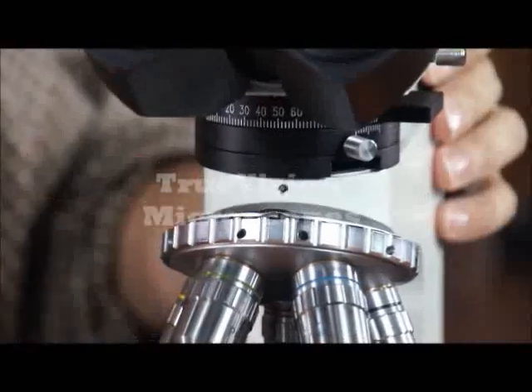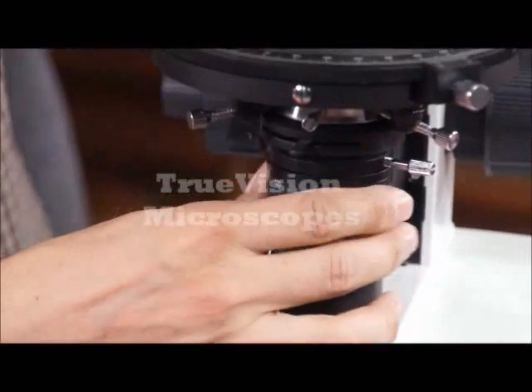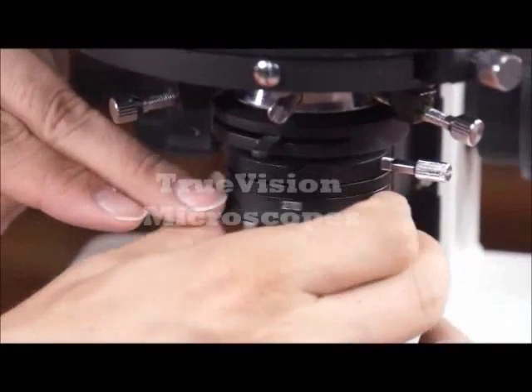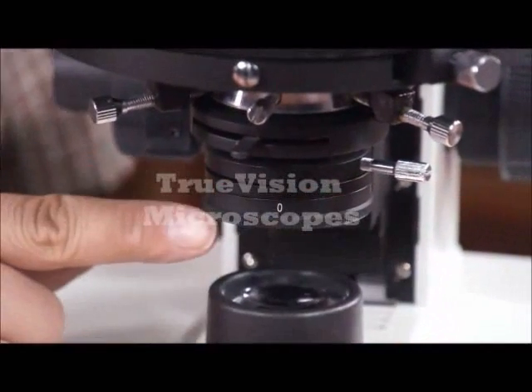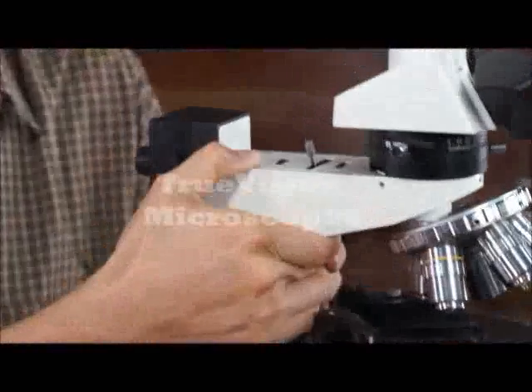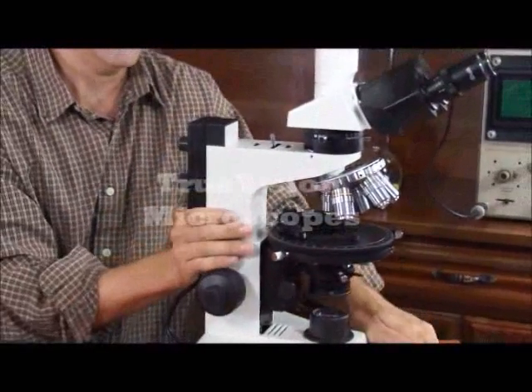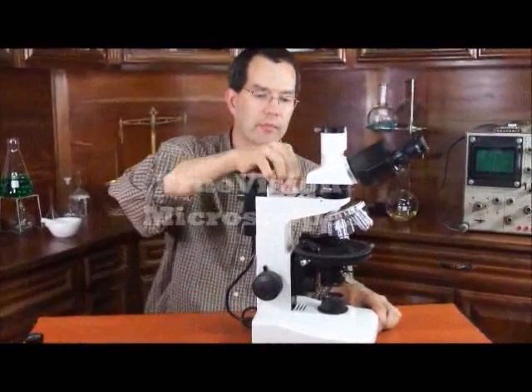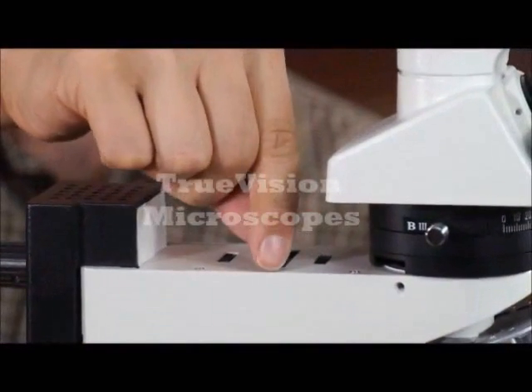To do cross polarization, you have a polarizing lens on the bottom transmitted light. This has markings from 0 to 90 to 180, 270 and back to 0 for a full 360 degree rotation. This is the polarizing lens on the transmitted light. On the reflected light, we also have polarization — this is the polarizing lens on the reflected light. It goes 90 degrees.